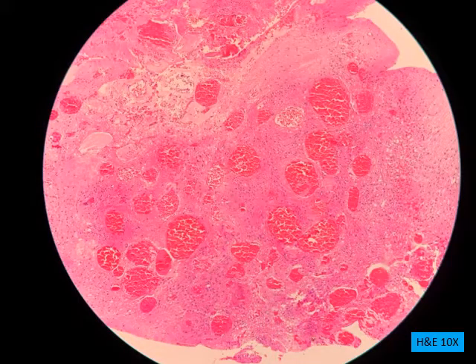So here is another fragment, but this fragment of tissue is a little bit different compared to the previous fragment. Here you can still see there's a variable size and shapes of dilated blood vessels, but in between these blood vessels there is some tissue. It's not just a fibrous tissue, but a different type of tissue.